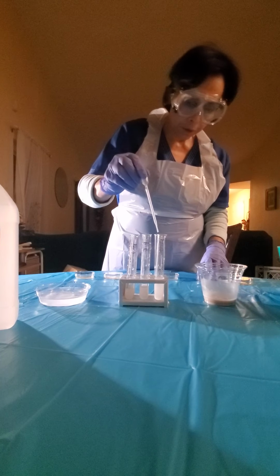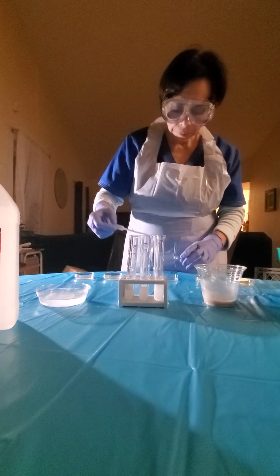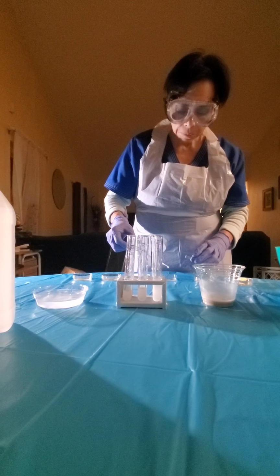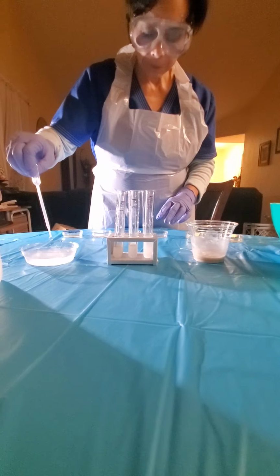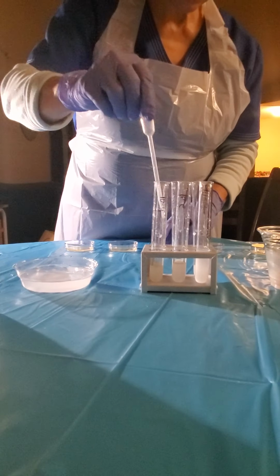And we're gonna go to number 3. And we go to number 4.